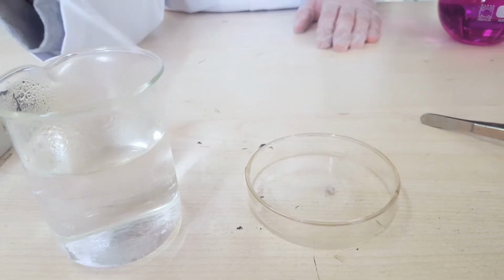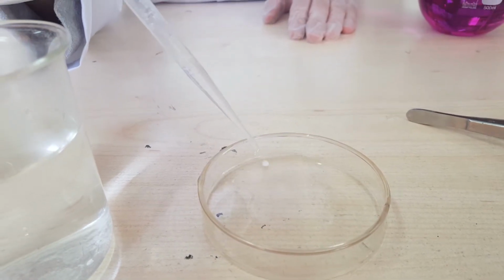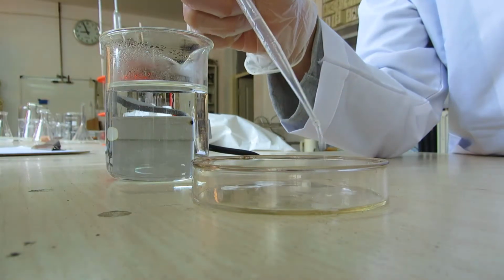With water at boiling temperature, the speed of the reaction goes really fast, and the heat happens like a sparkle.